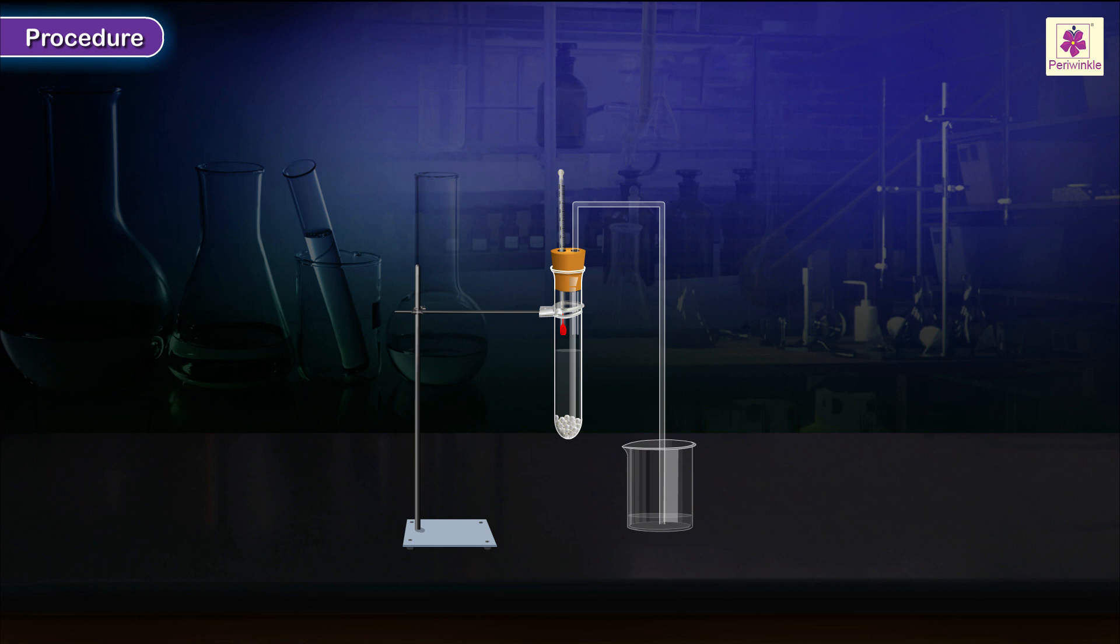Fit the test tube in a clamp of an iron stand such that the lower end of the delivery tube lies in a small amount of water in a beaker. Mark the level of water.